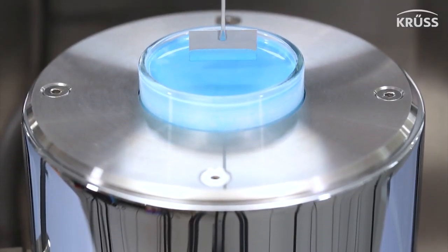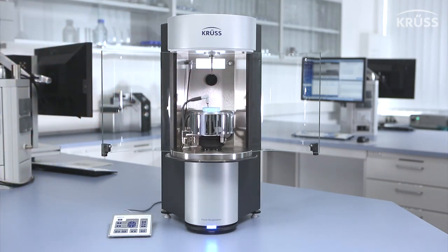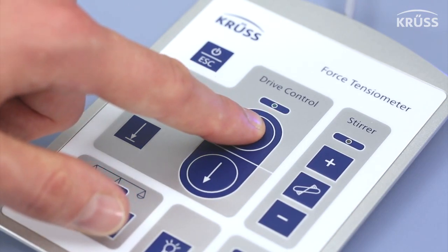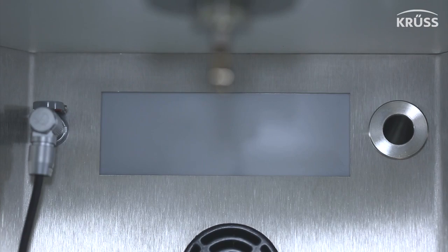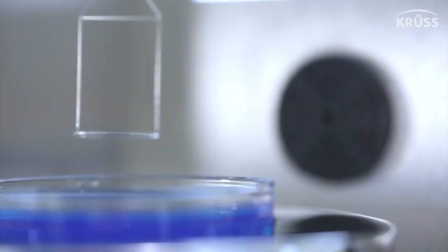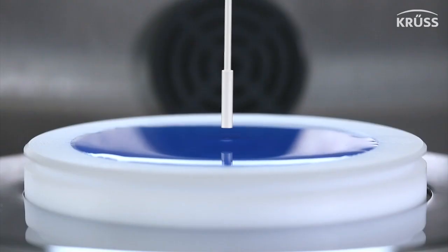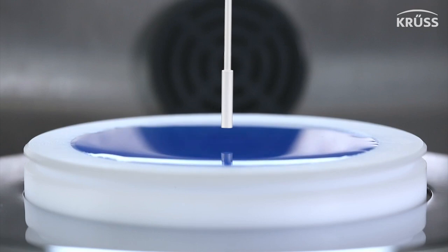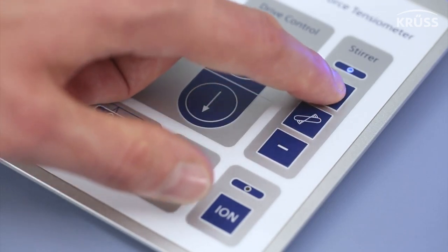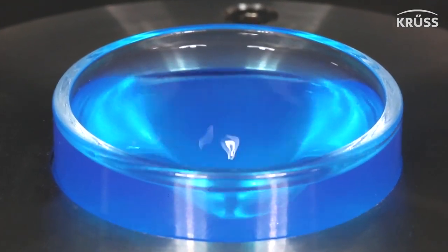As soon as a measurement is ended, the force sensor is automatically protected from damaging bumps by using the interlock feature. The easy-to-use keypad lets you control the sample stage, illumination, and other components with the click of a button. The built-in ionizer ensures reliable contact angle measurements by automatically removing the effect of static charge. And the stirrer uses deactivatable electromagnets to ensure optimum homogenization of dispersions or rapid equalization of concentrations.